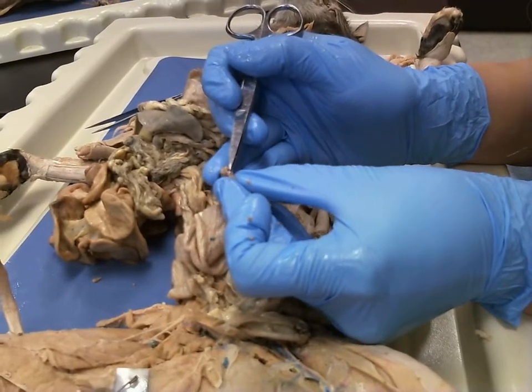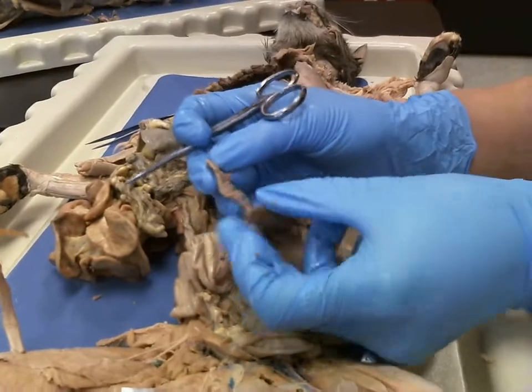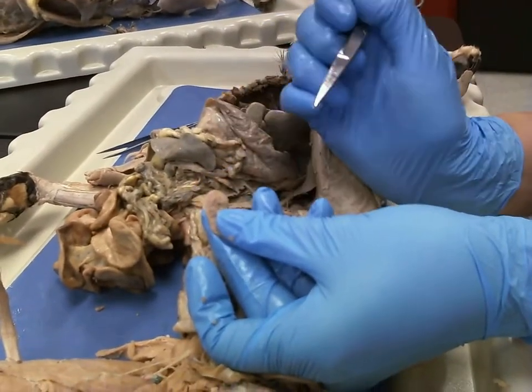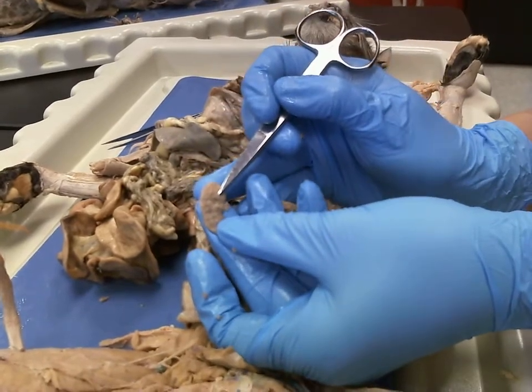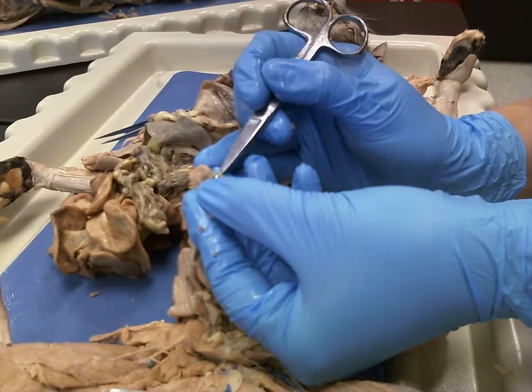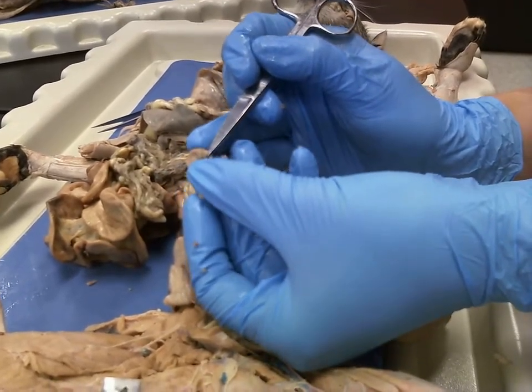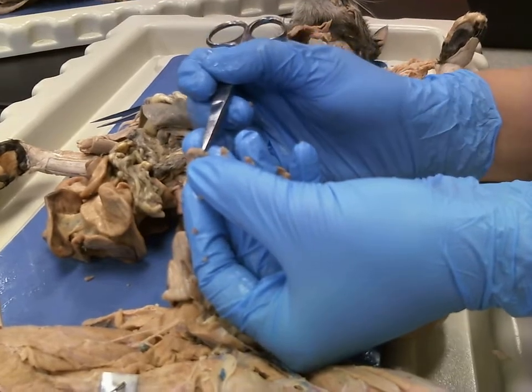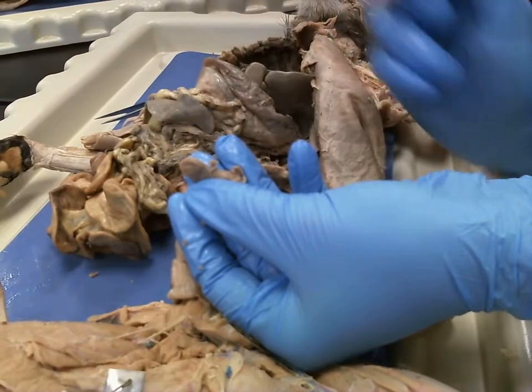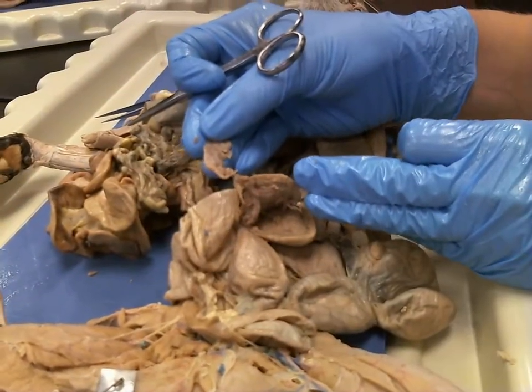This looks like it is probably a little boy kitten. As you flip this up, you notice this is your heart prominence right there. You can see your eye. And then when you flip this up and look in here, you can see we have our mouth right there. And if we flip that, you can actually see your tongue. So you've got your tongue and both sides of your mouth. So that's going to be your kitten fetus right there.